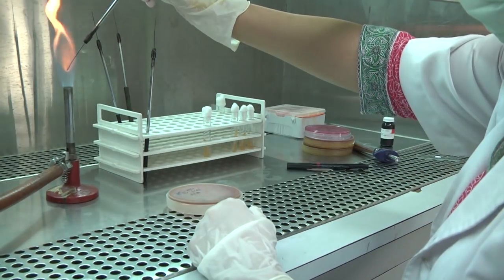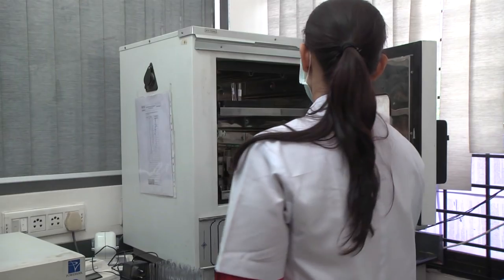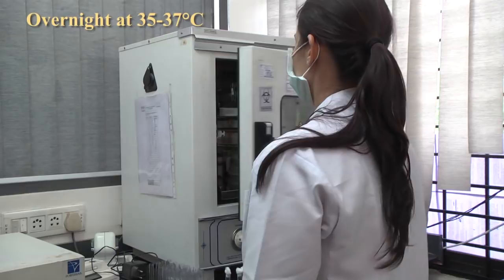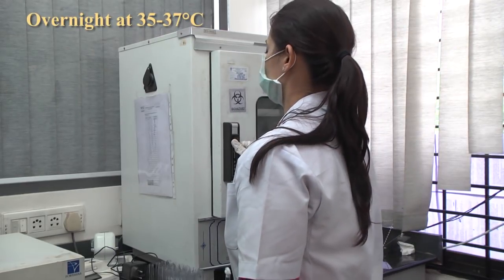Flame the mouth of the slant again and replace the plug or cap. Sterilize the loop after the inoculation. Incubate the agar slant medium overnight at 35 to 37 degrees centigrade.